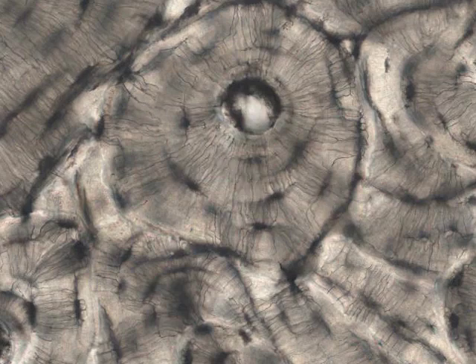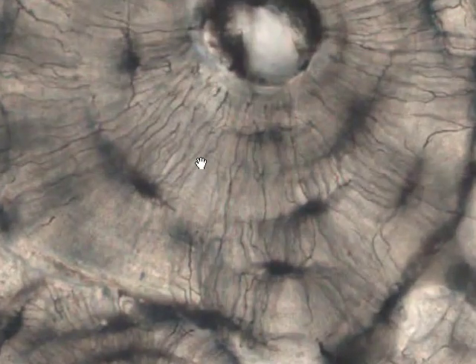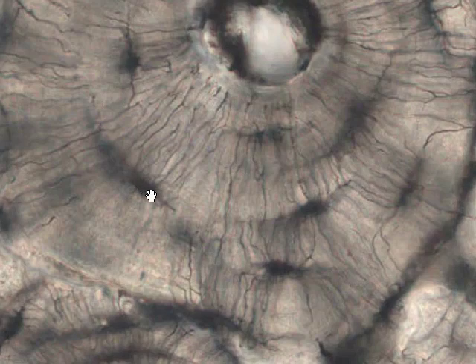And as we move to the maximum magnification, we'll see the structures which enable these guys to communicate. Each of these osteocytes trapped in its lacuna extends thin tendril-like processes out through the bony matrix in small canals called canaliculi. And these processes make contact with, and if you like, speak to the surrounding osteocytes. So here's an osteocyte. Here are the processes extending out in the canaliculi.